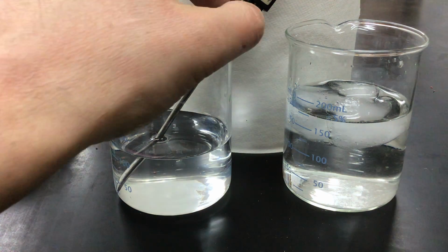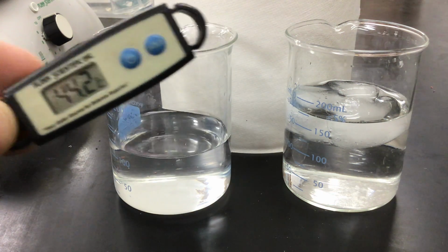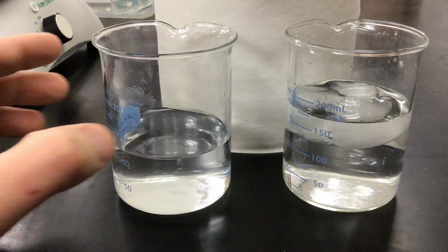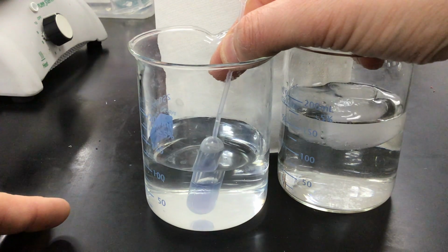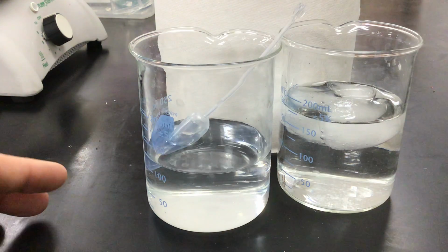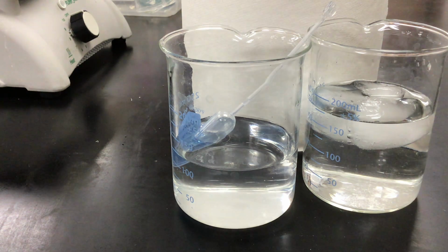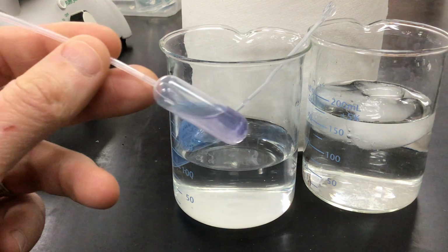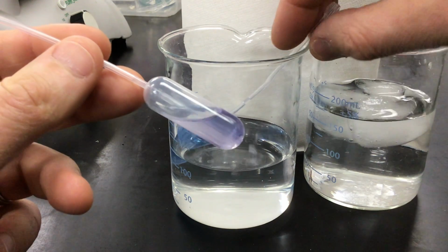Now, in the beaker on the left, I have heated the chemical compound. Right now it's around 50 degrees, and I'm going to place that barrel pipette into it. I'm going to let it sit there for a few seconds. I have a second test tube that I will use as a reference so we can see what happens. All right, so I'm going to now pull this sealed barrel pipette.